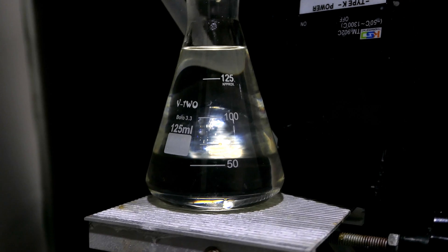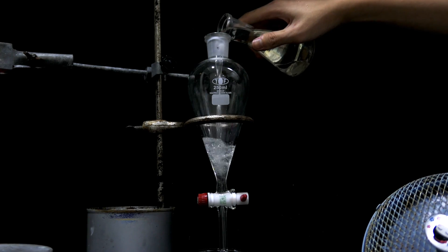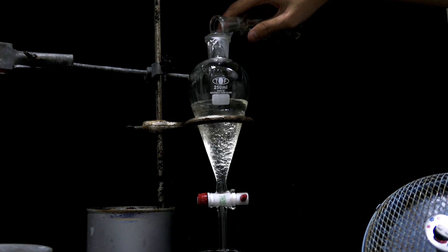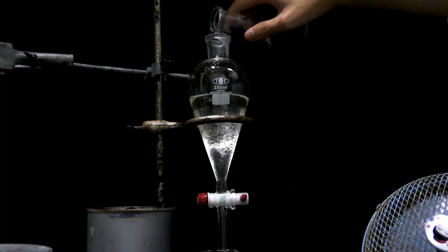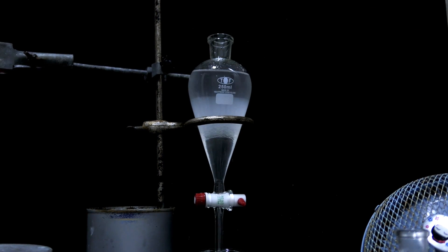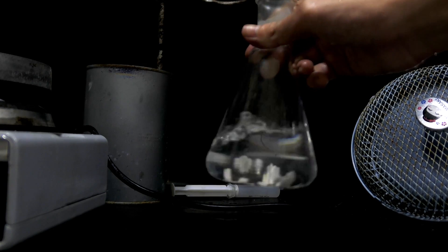Distillate between 80°C to 130°C is collected, and the distillate separates into two layers. The upper layer is mesityl oxide and the lower one is aqueous layer. Separate the two layers in a separatory funnel, and wash with saturated sodium chloride solution. Finally dried over anhydrous calcium chloride.